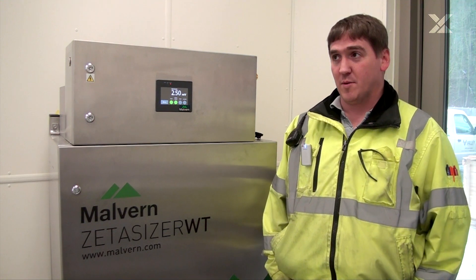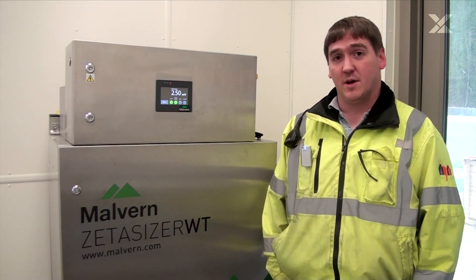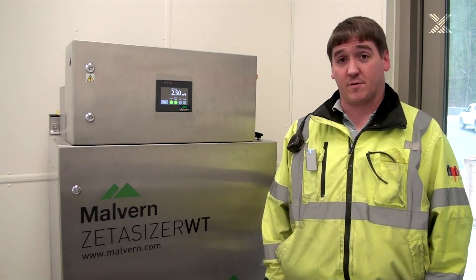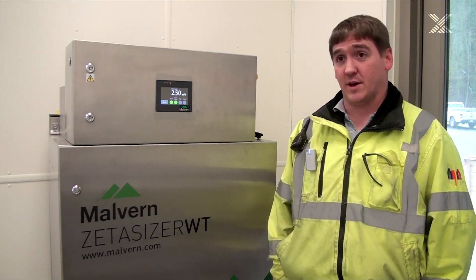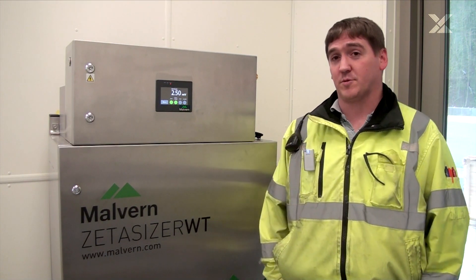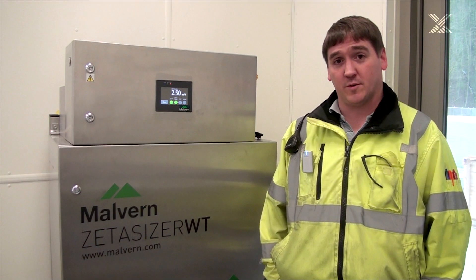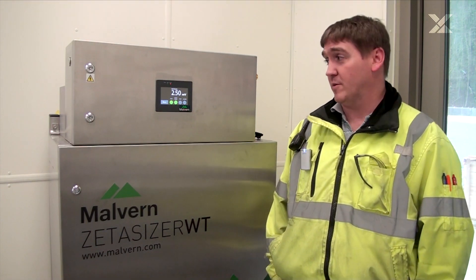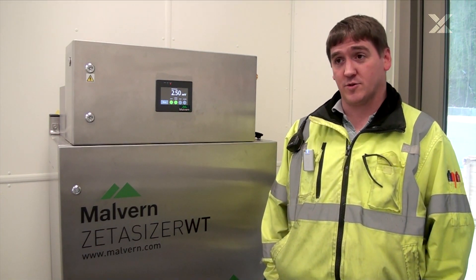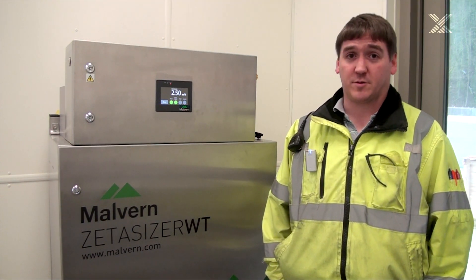We're a brand new filtration facility, although we do have some operators from outside water treatment plants. This is our first water plant here in Tacoma — so after a hundred years, we're filtering the Green River for the first time — and this instrument has been extremely useful in telling us if we got the right dose for treating the water and getting us repeatable results for our customers.